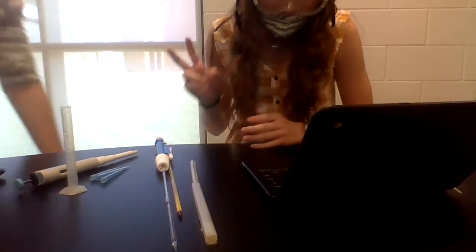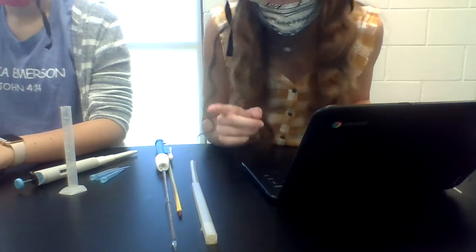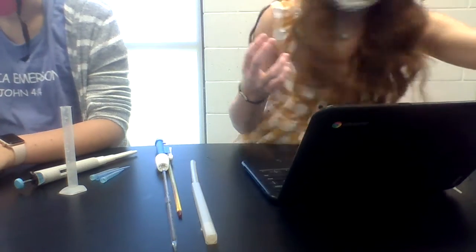Okay, that one was supposed to get to 2 milliliters, and we got to 1.89. We were close. I think that worked better than that. Okay, so that means that this is 1. Take 3. Hey, it stopped recording. That's really good. It is too tall. There it is. Take 3. Alright.